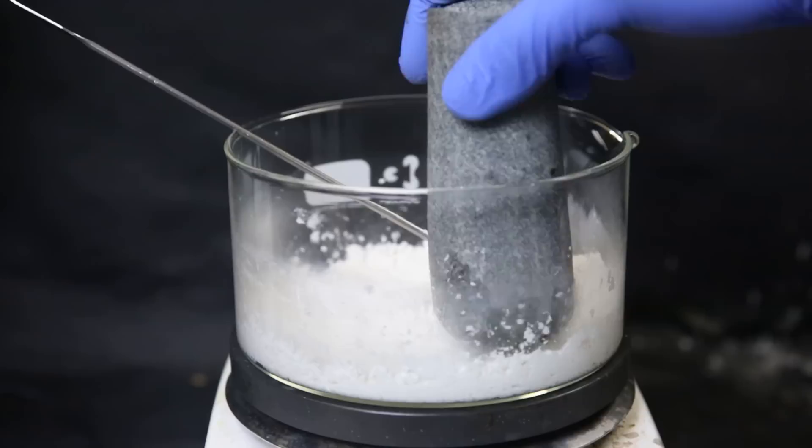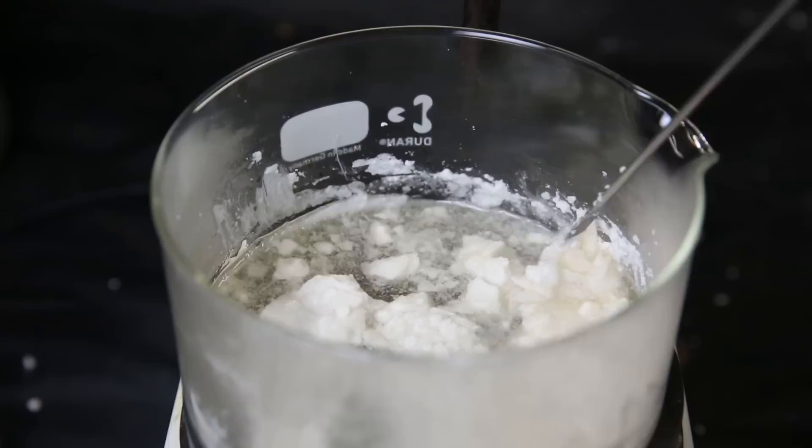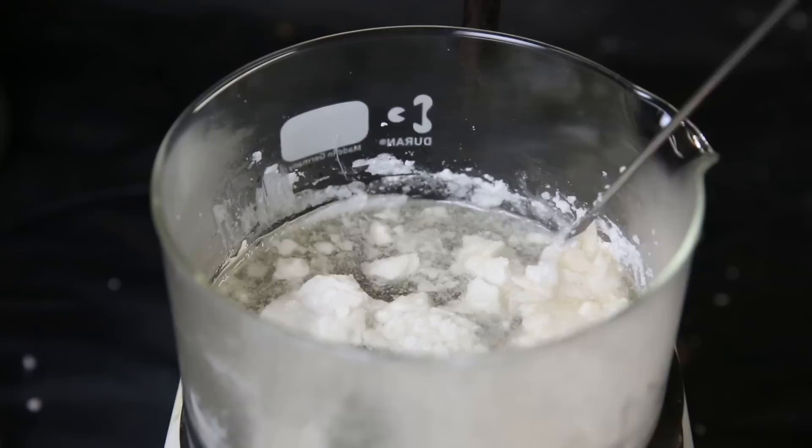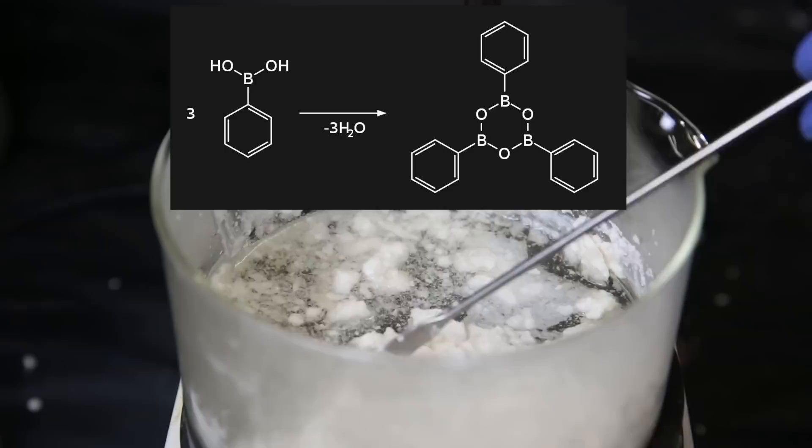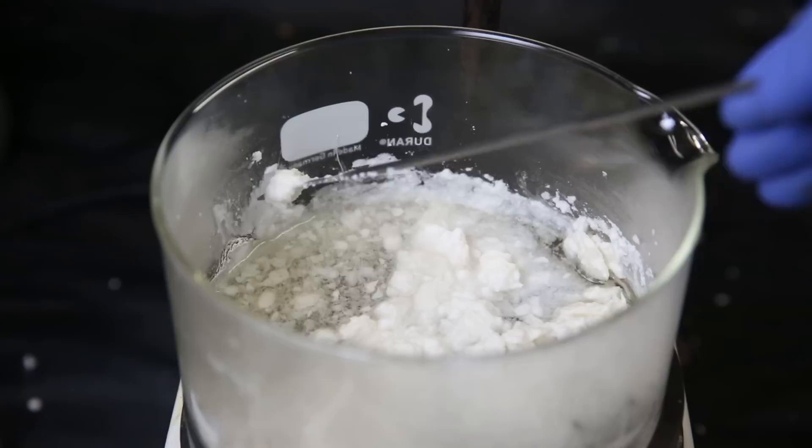I have to be careful with the drying step to not remove too much water, since the boronic acid will dehydrate and form boroxines while releasing water. We can see this equilibrium reaction take place. Besides it having increased solubility in the hot water that was remaining, it is also dehydrating into triphenylboroxine and releasing water. So it becomes a liquid with a lot of chunks, which keeps forming a solid layer on top. When the heat is taken away, it will form back into phenylboronic acid. But if too much water is evaporated away, it will stay in its boroxine form, unless it is rehydrated.